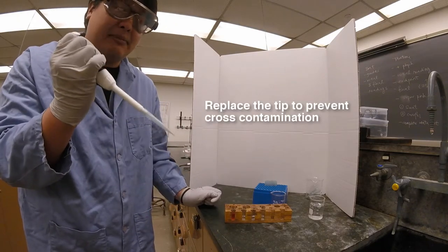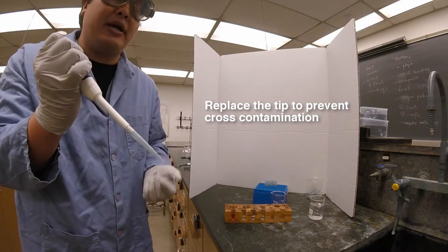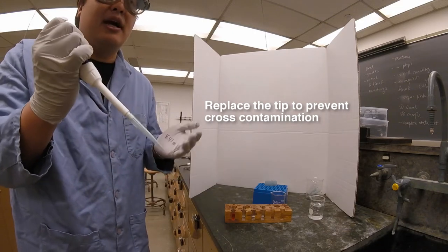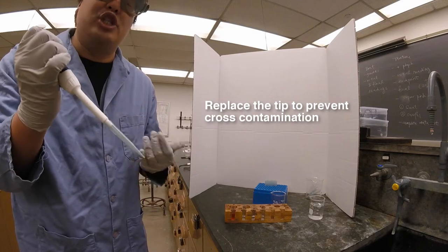The reason that you don't want to use the same tip throughout these dilutions is that you might cross contaminate and make some solutions a little less or more concentrated than it should be.